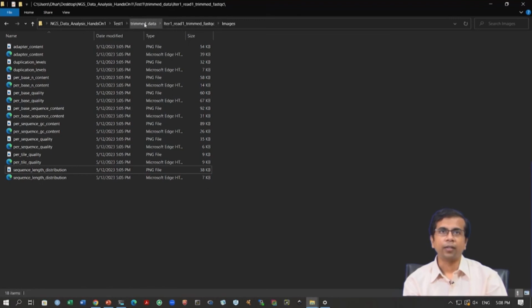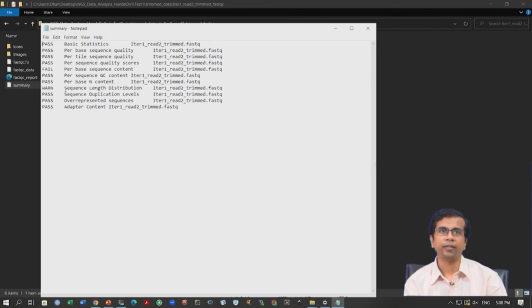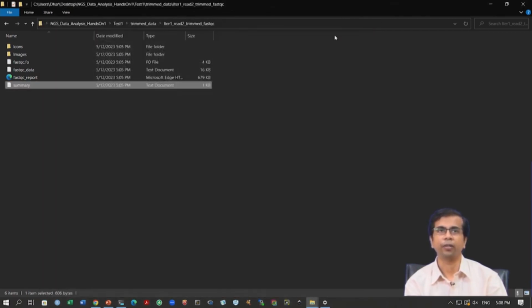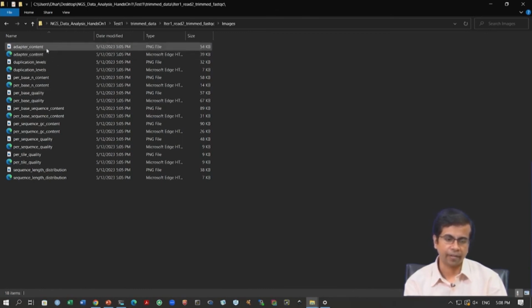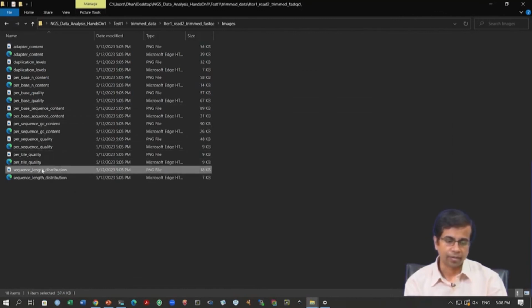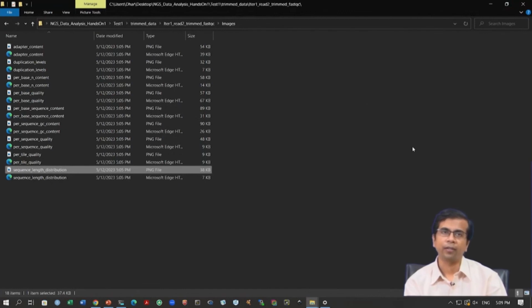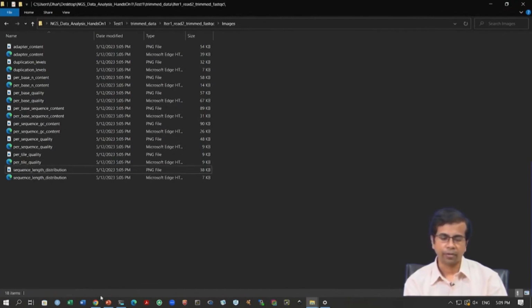Okay. So, we can now look into the other one as well, which is for the read 2. Okay, and again we can look at the summary file first, and you see similar results. Again the warning for sequence length distribution, but the adapter contamination is gone. Okay, it's passed, there is no adapter contamination, and we can confirm this through these images again. So, here is the adapter content, and it looks great, and we also have the sequence length distribution, and it is a very similar story compared to the other file. Here you have sequence length, where most of the reads are of length 125, but you have some reads that are very, very small, but that is okay. I think we can go ahead with this data and it looks fine. It does not need any further pre-processing.